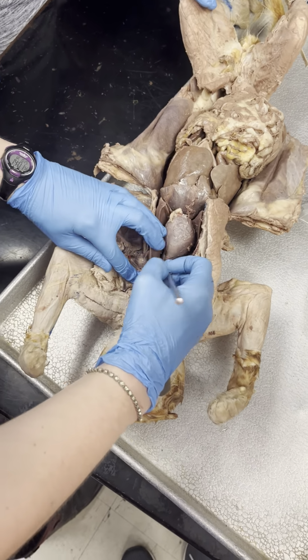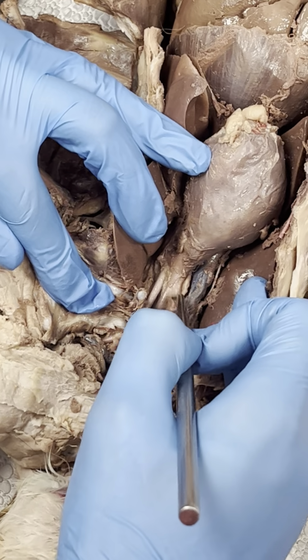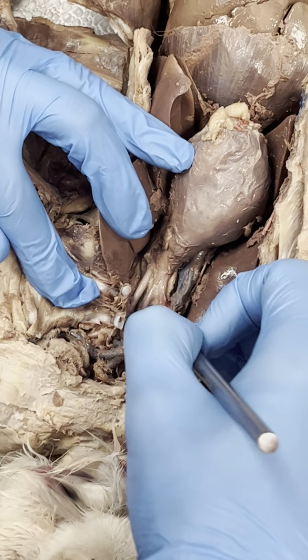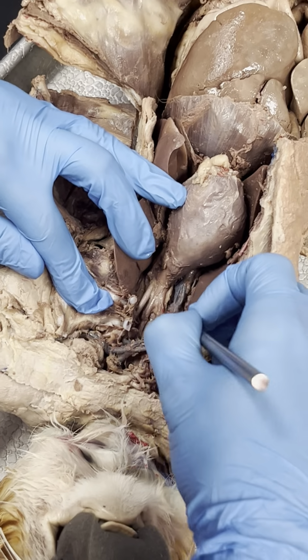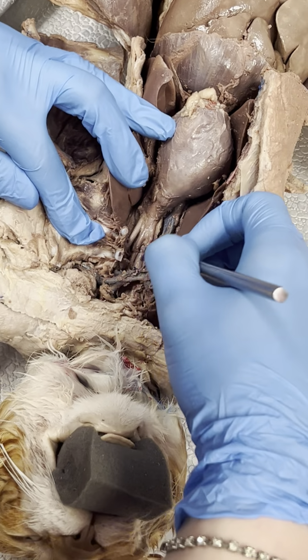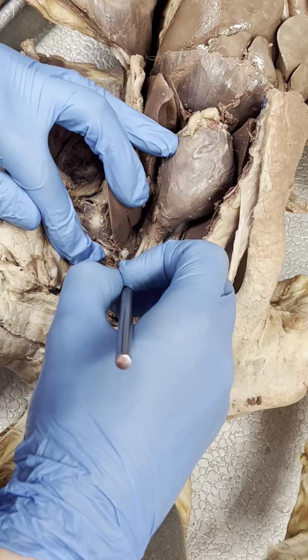My hands are this tired. You didn't have to hold anything. All right. See if I can spread this out a bit. Start. I need a little break.